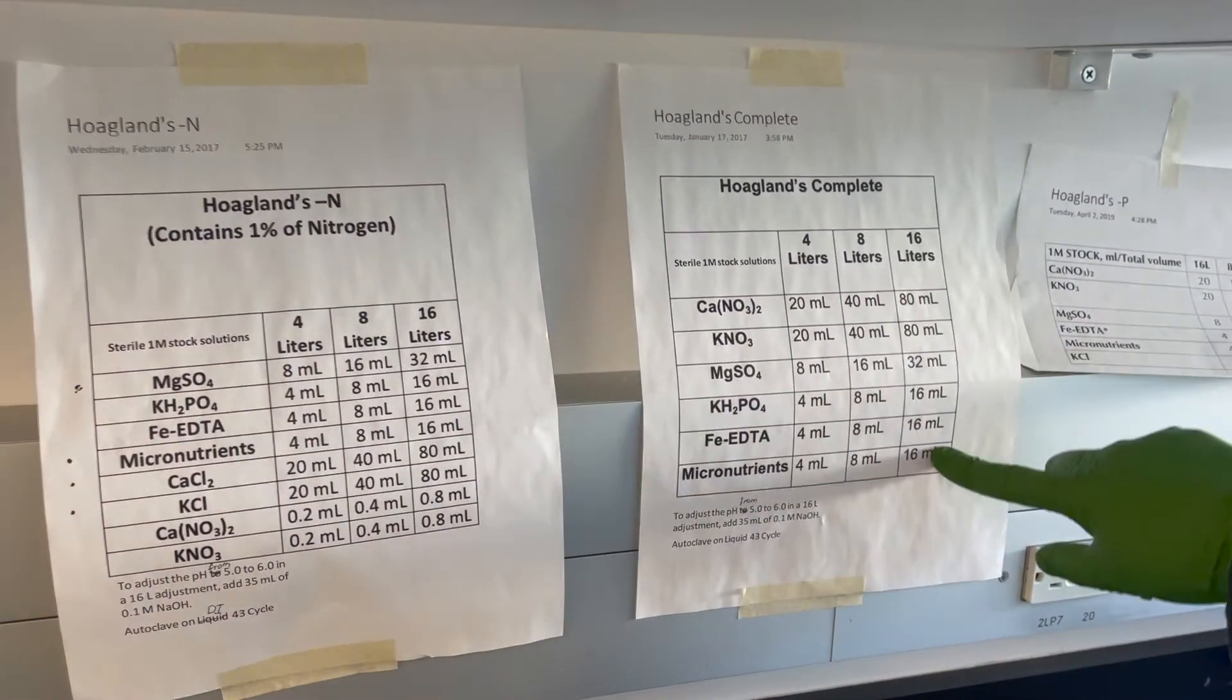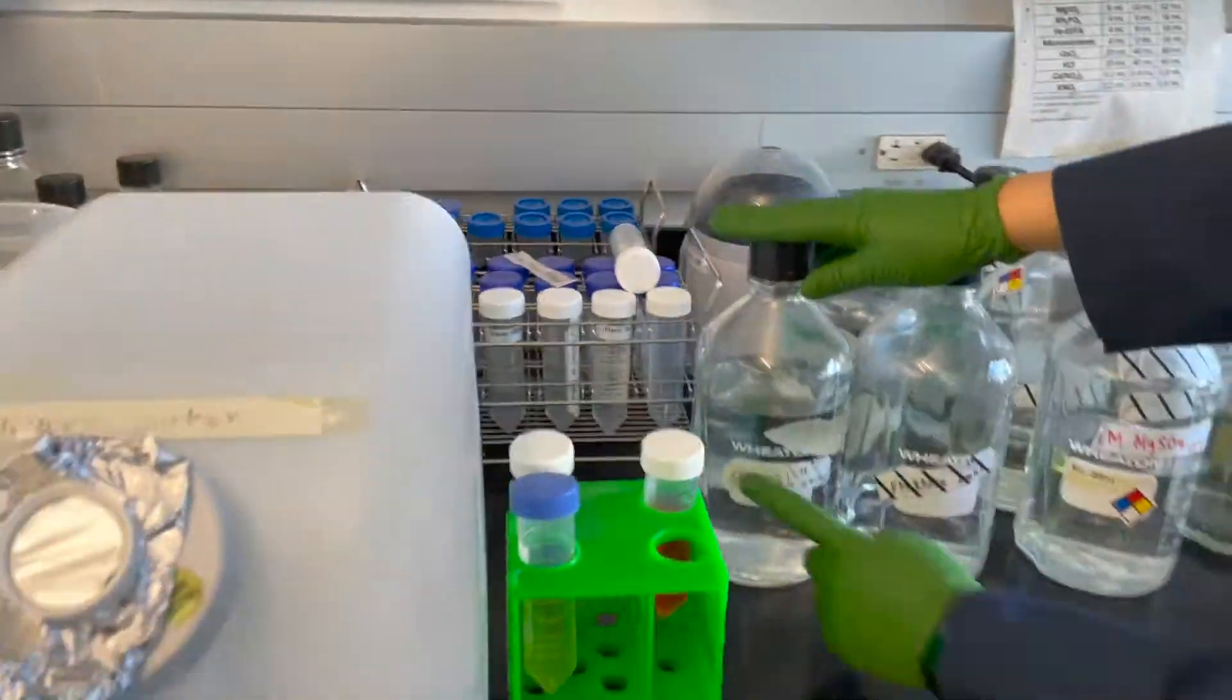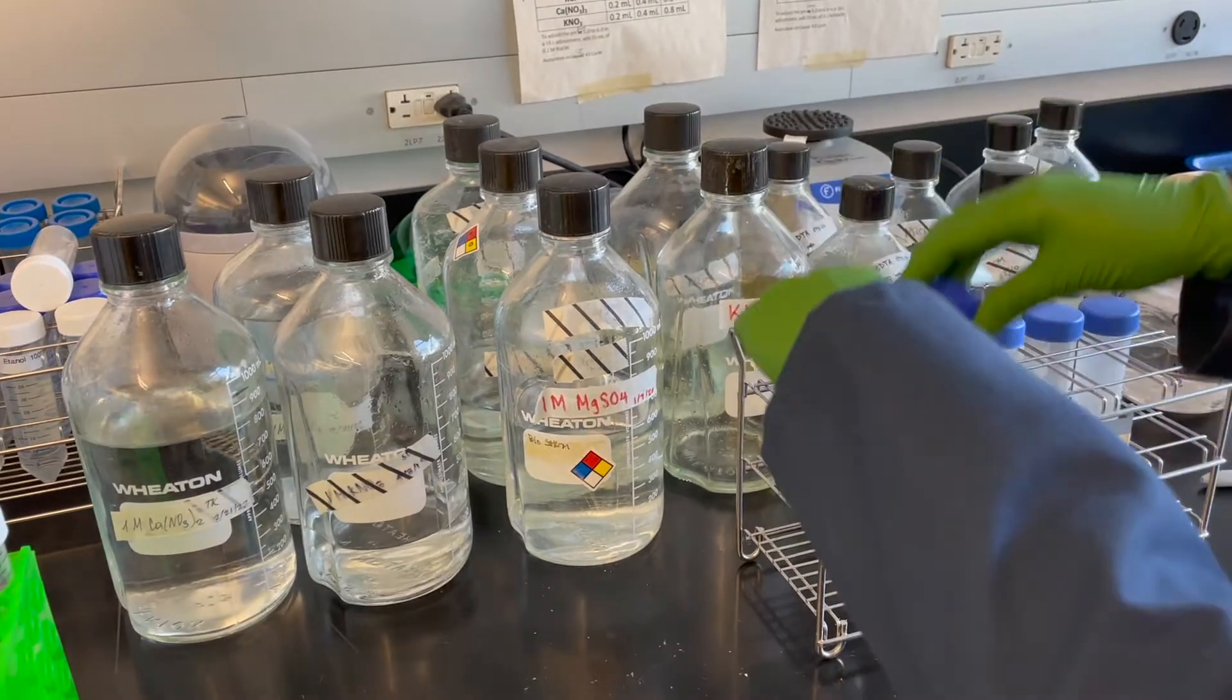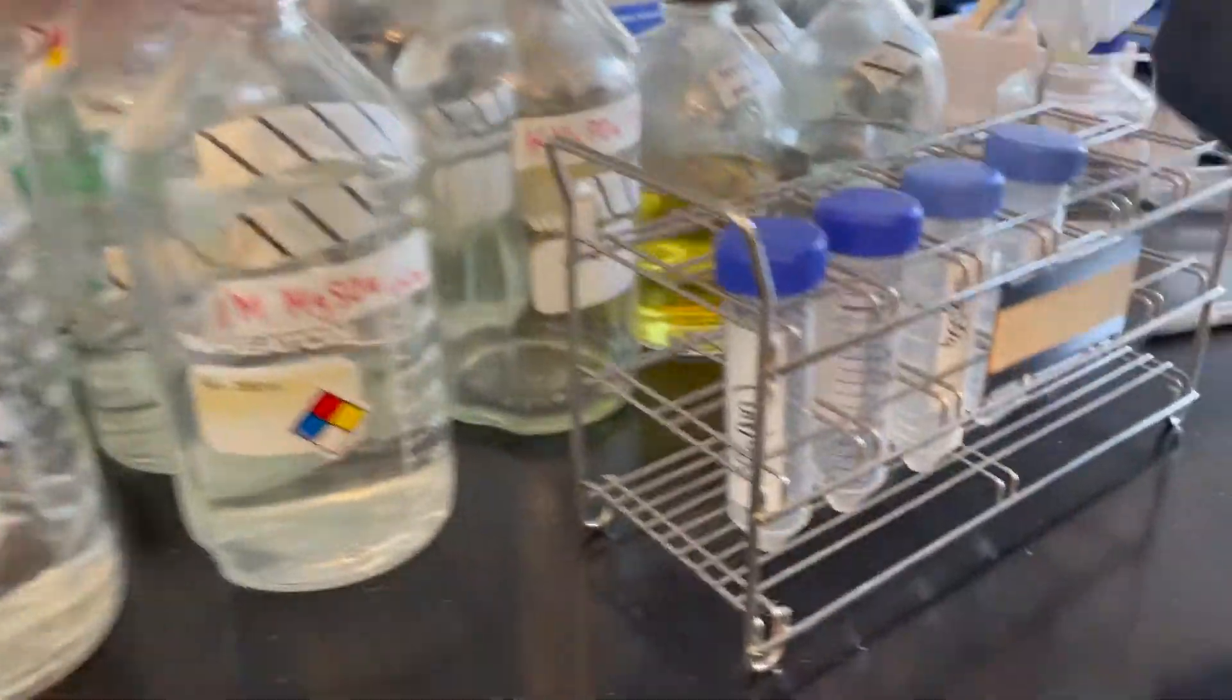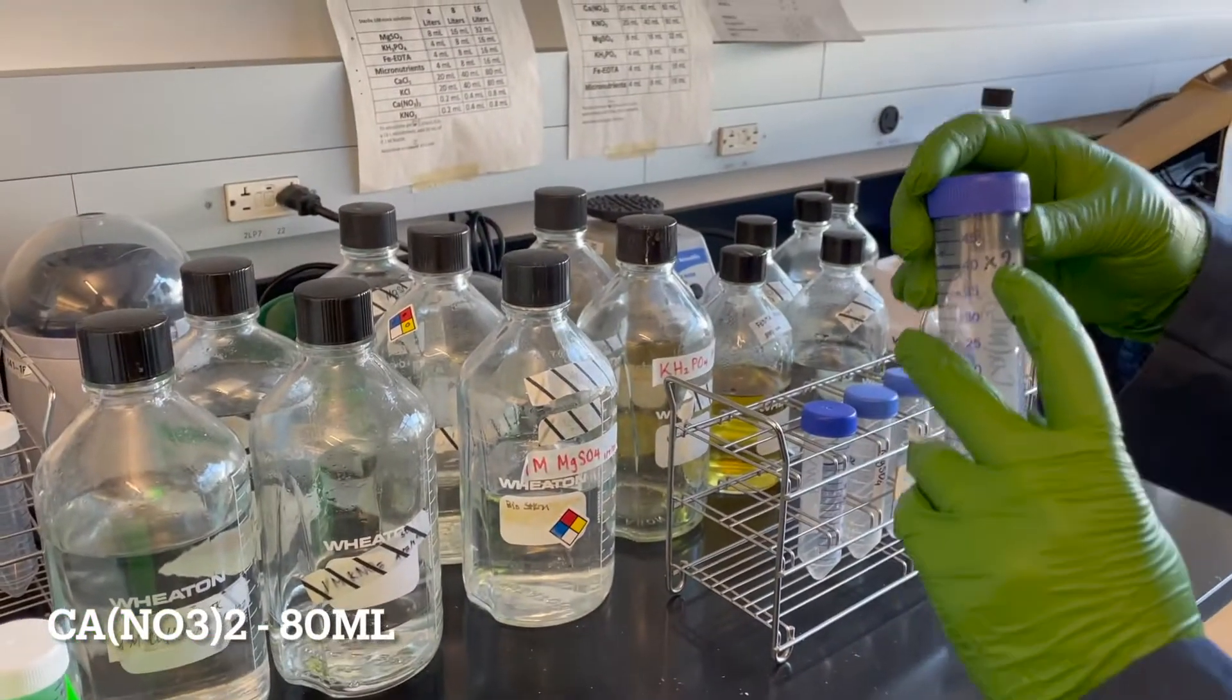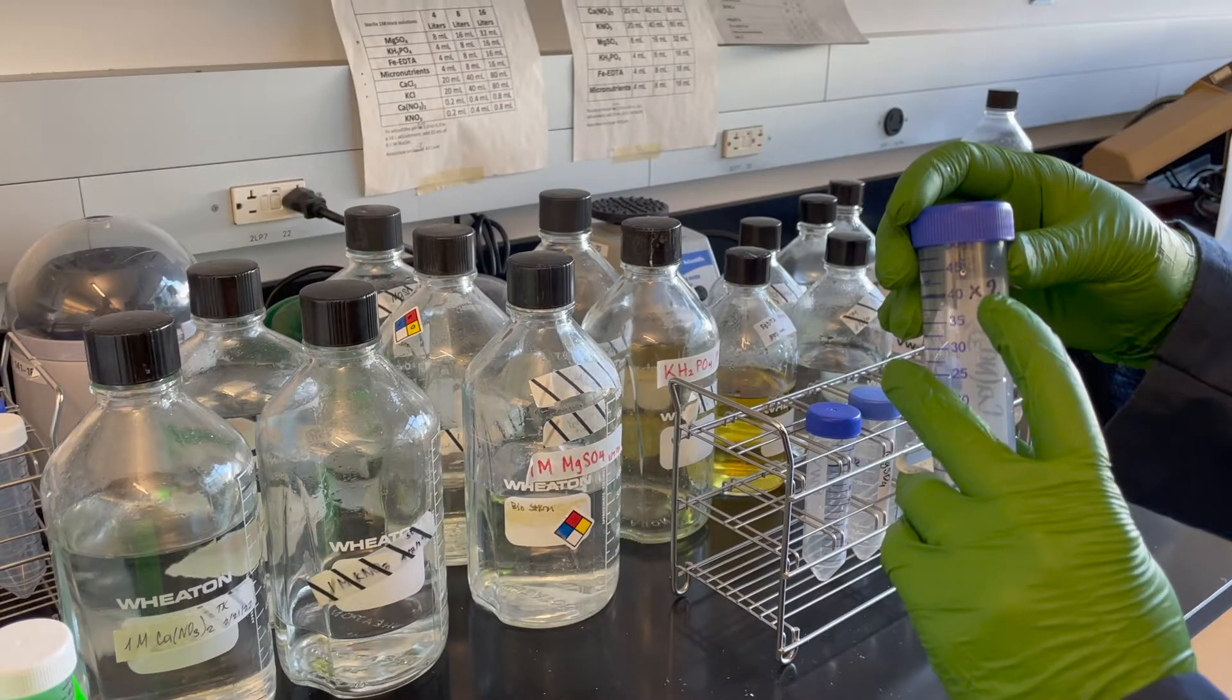Prepare all the chemicals you need for your recipe. I like to line them up in the same order as the recipe calls for. Additionally, I'm using tubes as secondary containers to measure the volumes of the stock solutions, and I'm lining up those tubes in the same order.